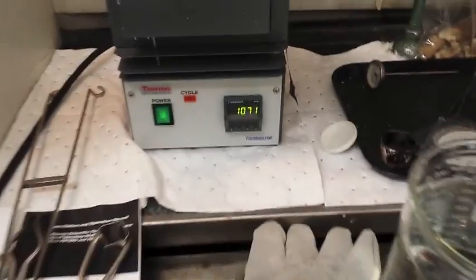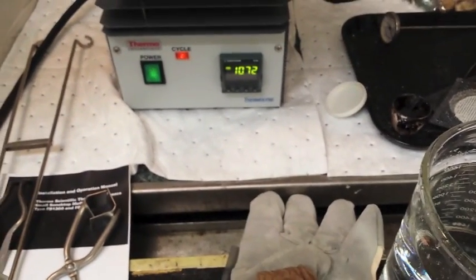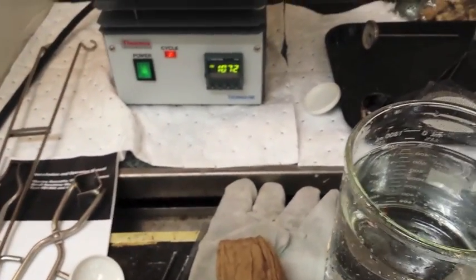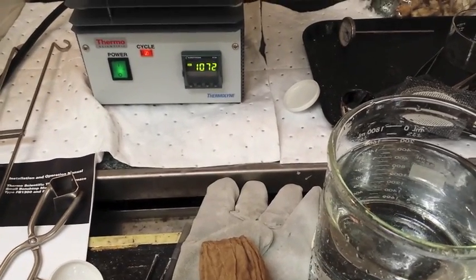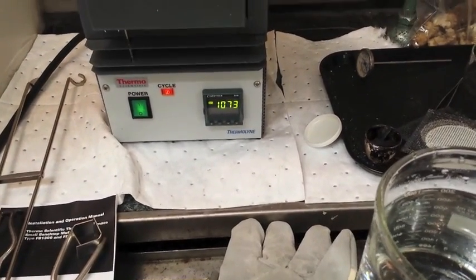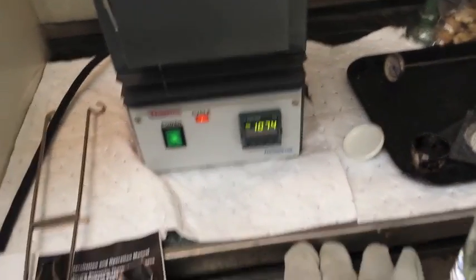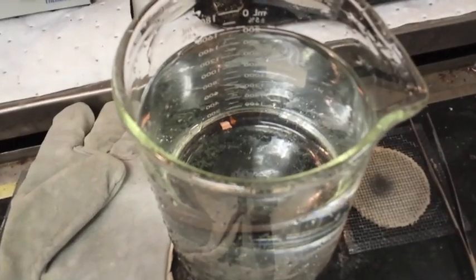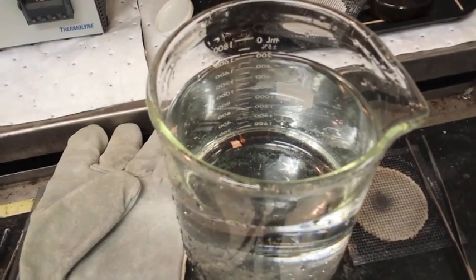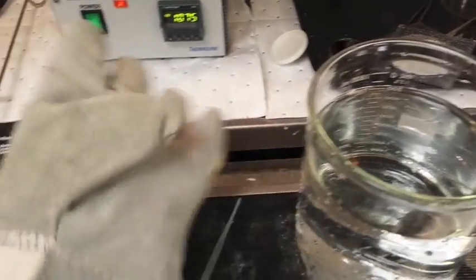Okay. So we're ready to do this. As you can see, our temperature is 1071 degrees Celsius. 72. It's moving up. It's maxed out at 1100. That is above the melting point of gold. It's been above that for about five minutes. Enough to ensure that it's melted. I have 1800 milliliters of water.